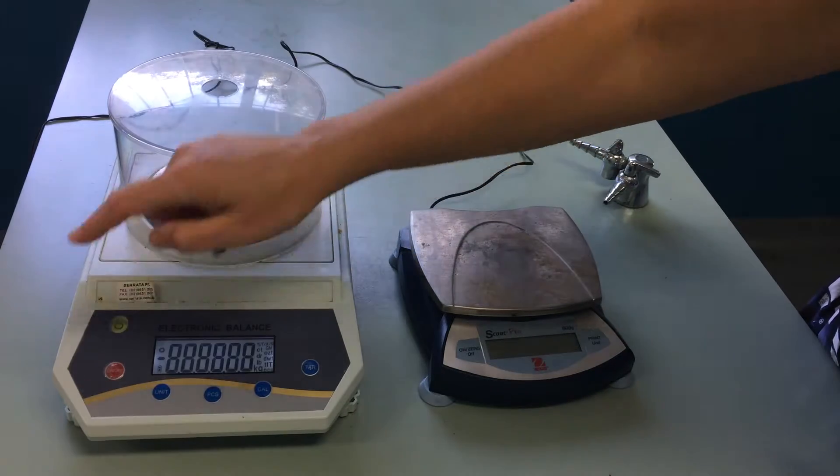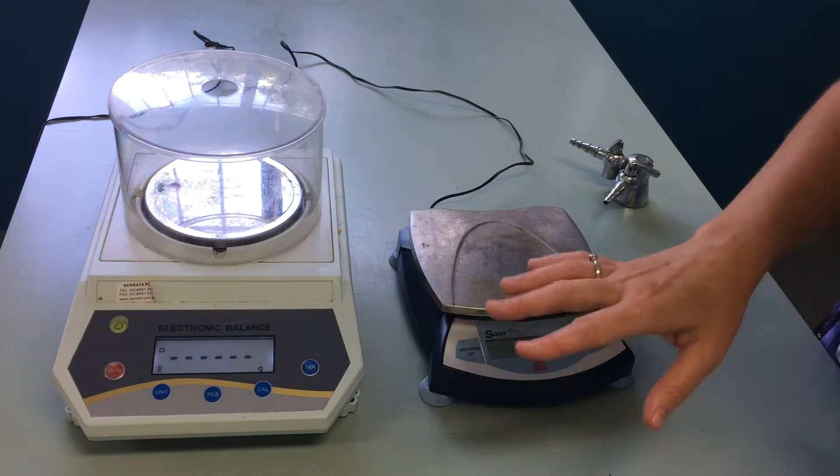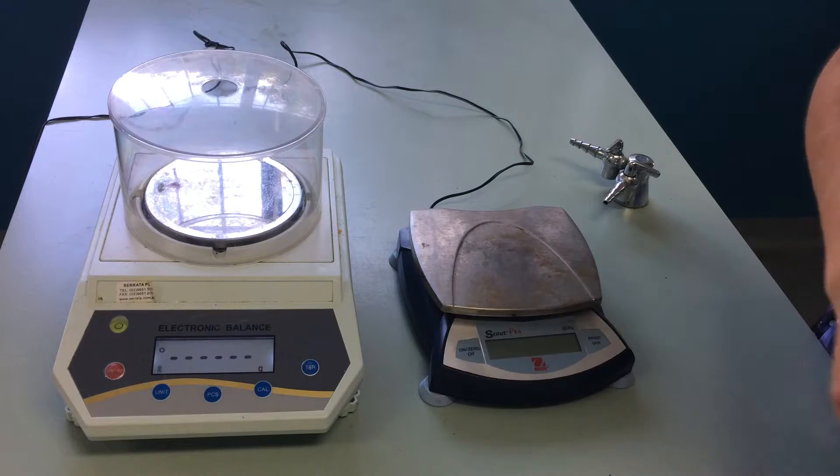Turn it on, and you'll notice lots of numbers coming up. You need to wait until they stabilize and it reads zero grams.